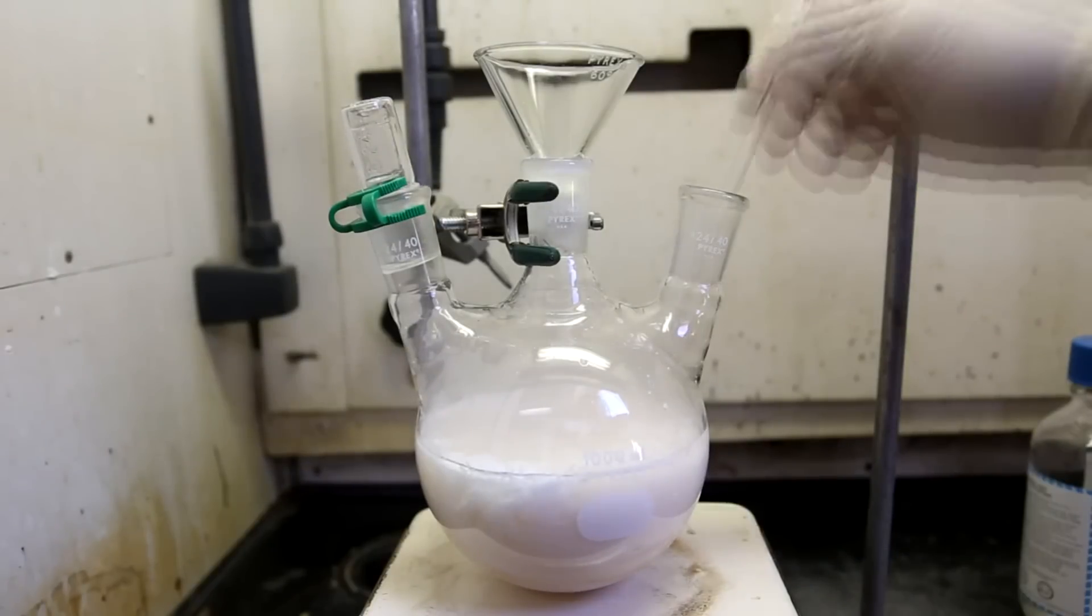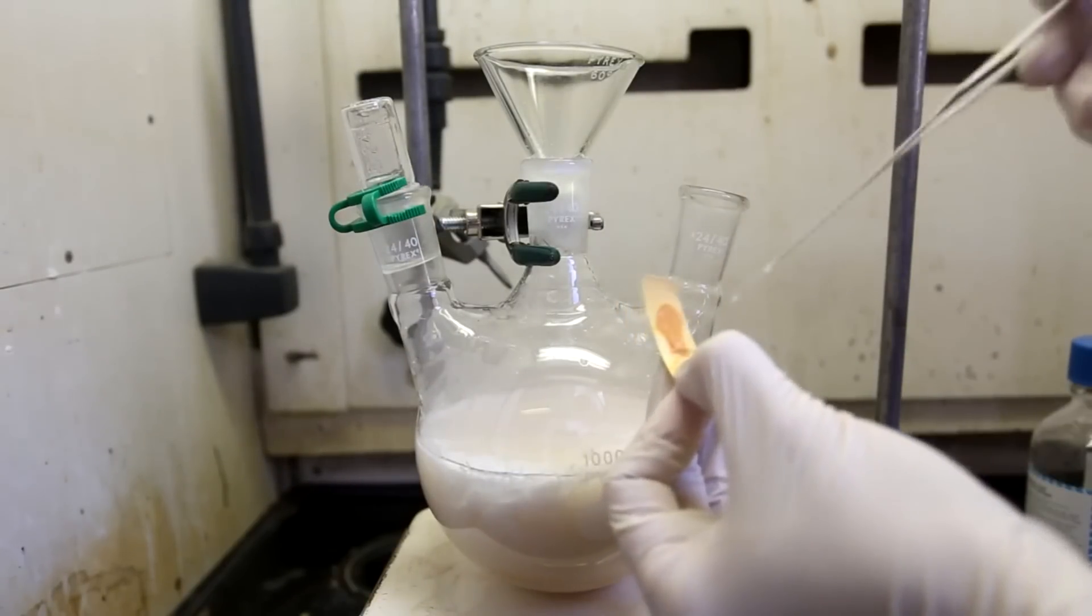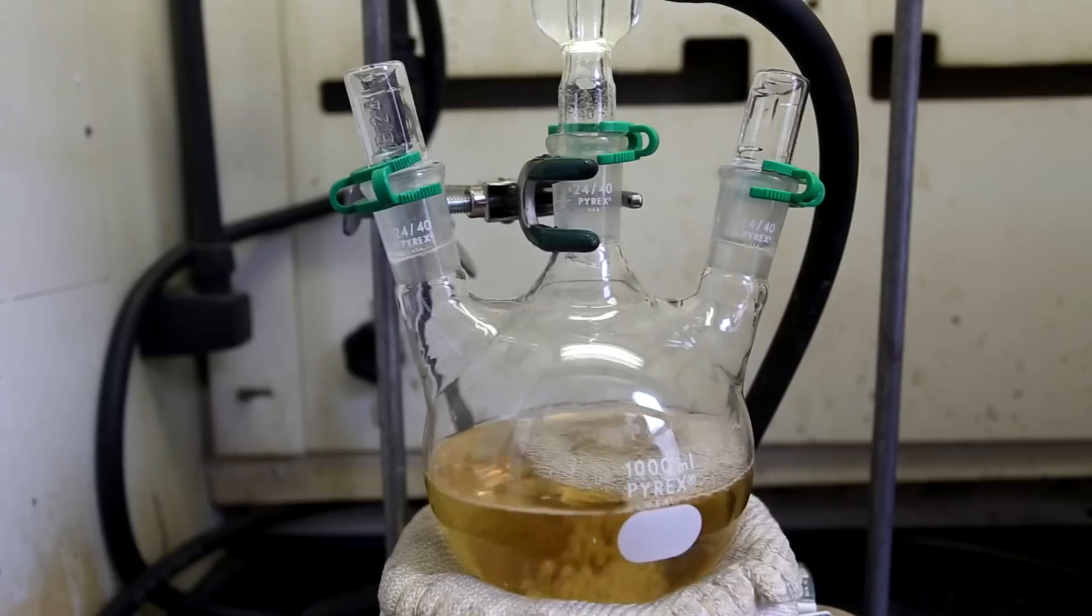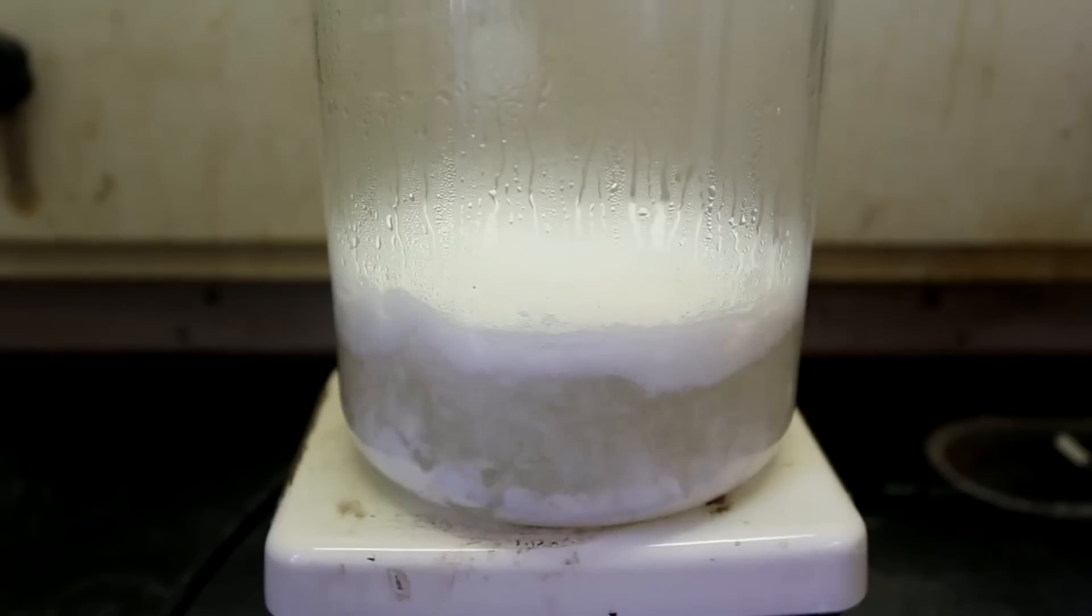This is a continuation of my video outlining the extraction of acetylsalicylic acid from aspirin tablets. In this video, I'll be converting the extracted acetylsalicylic acid into salicylic acid.